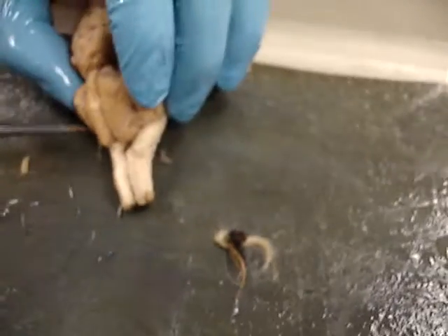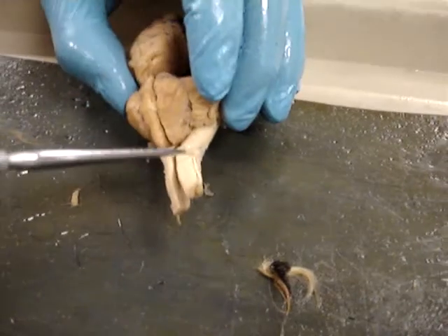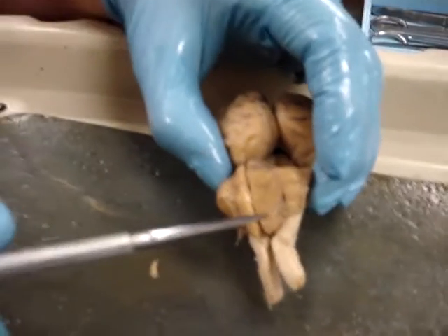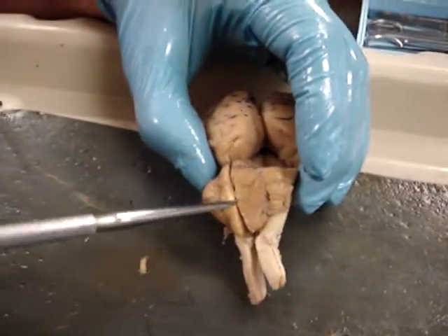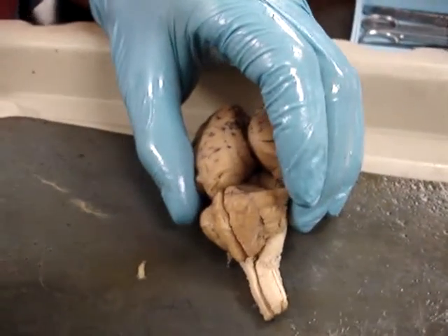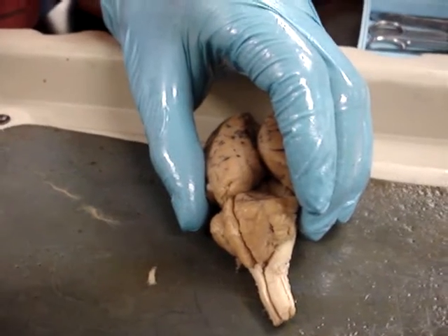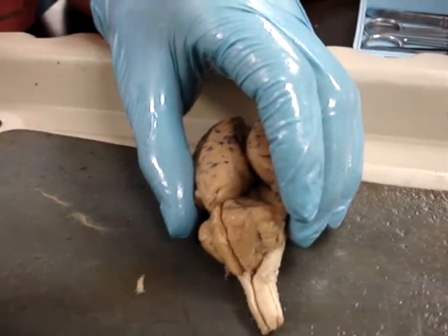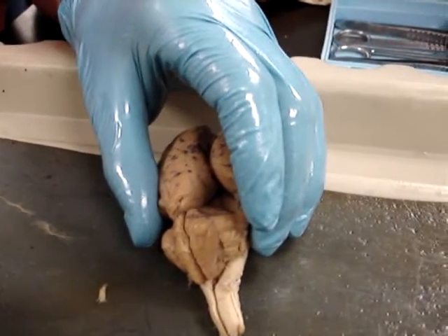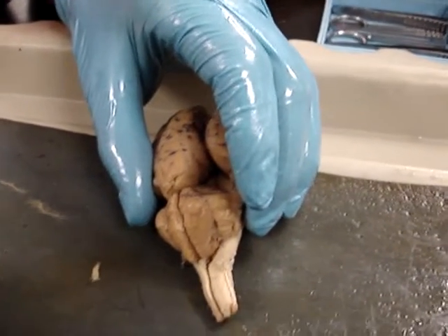There are two hemispheres of the cerebellum you have to know. One is the vermis — that's the middle part. And then the two outer cerebellar hemispheres.